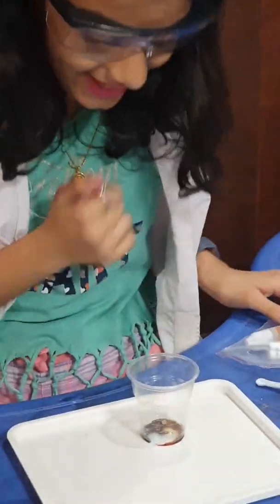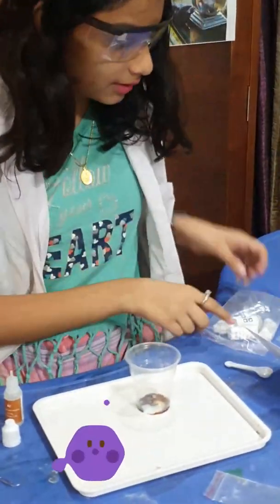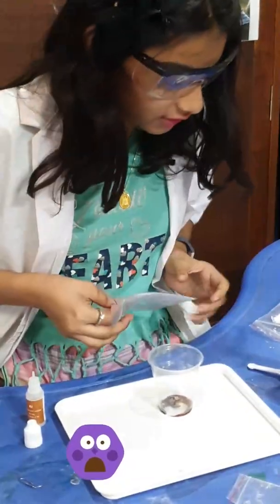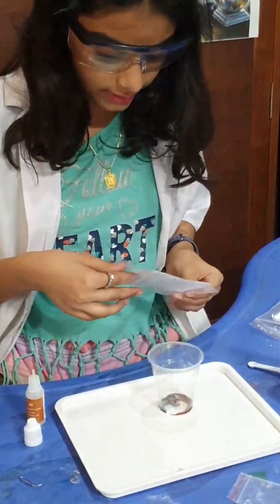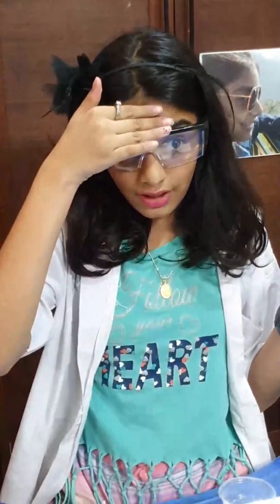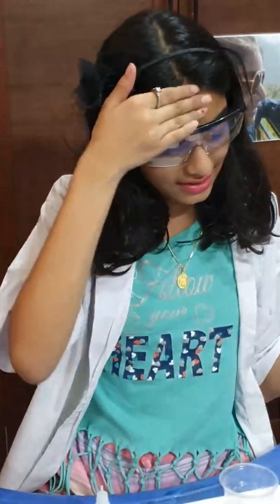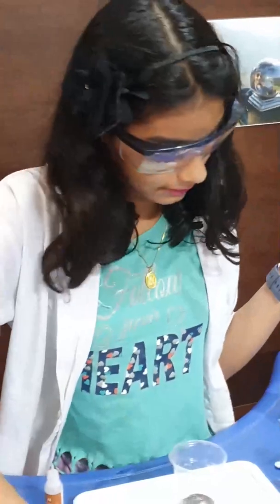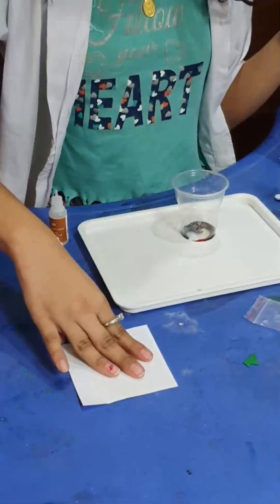Okay, very weird but let's move on. I think we need to do this quickly. Here we need our fingerprints — so I'll just do it as it's telling me: wipe your forehead with three fingers and leave fingerprints on the sheet of paper.